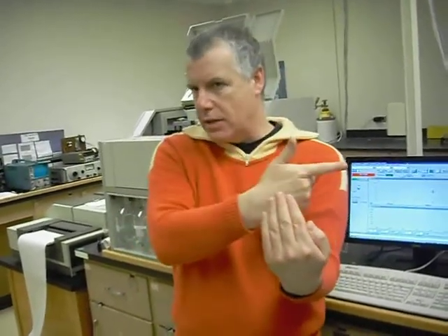The sequence almost always also includes a set of calibration standards and then the samples. So method, sequence, and then the report generation piece, which varies a little bit more. The latter is not the focus of my instruction now, so we'll use the default there.